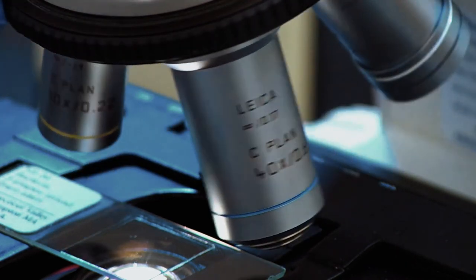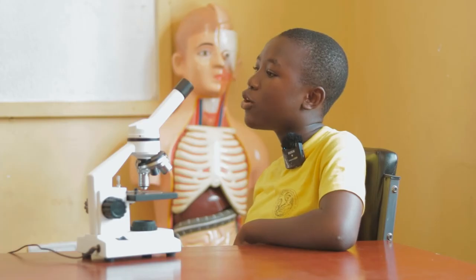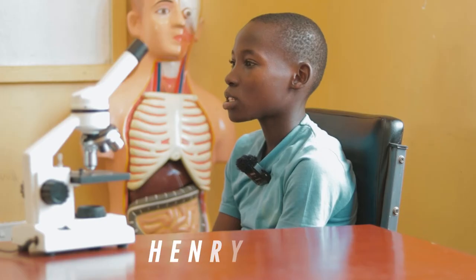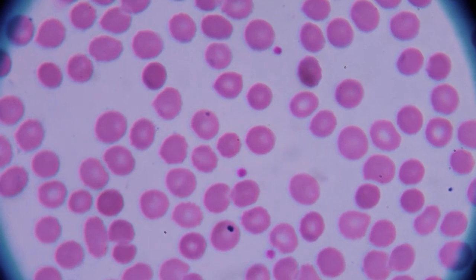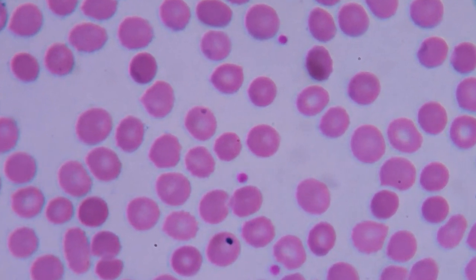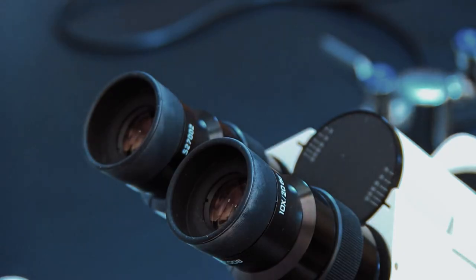There are several areas of application of the microscope, which include tissue analysis, examining forensic evidence, determining the health of the system, studying the role of protein within the inner cell, and studying atomic structure.